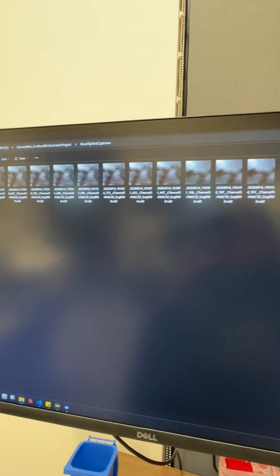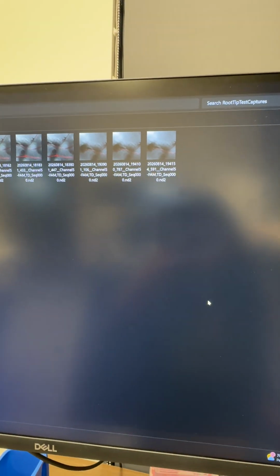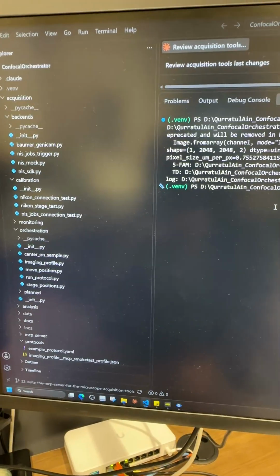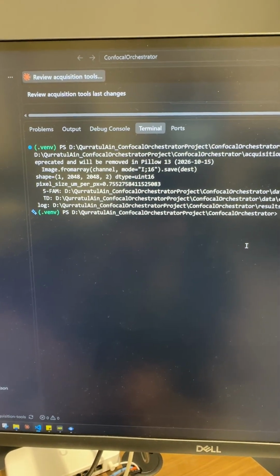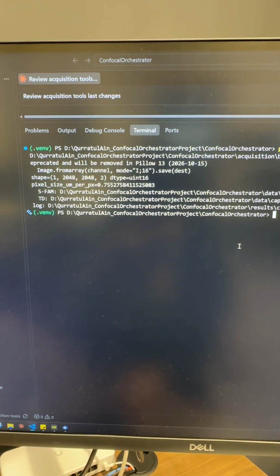This is where I have saved the files in a separate folder, and all these are ND2 files. We are saving all these details in a separate folder inside the capture, which contains the pixel size and the channels they have used to acquire. If you see, there are 5 FAM and TD channels respectively.